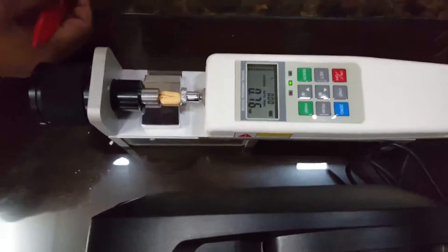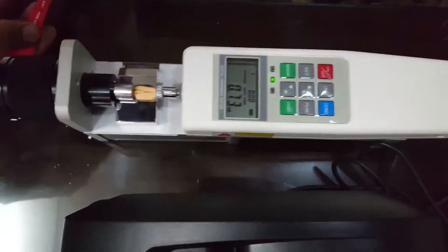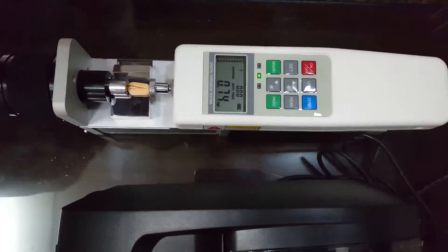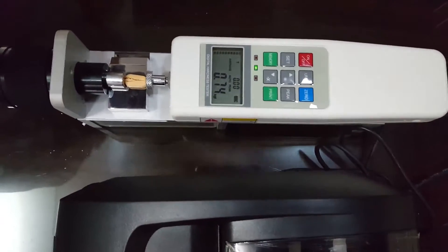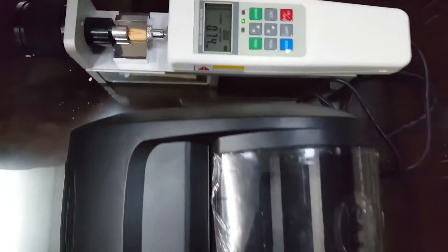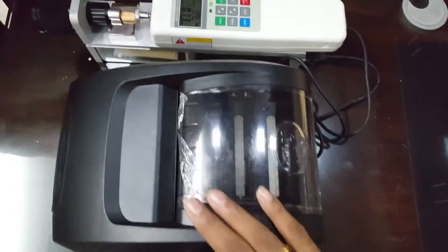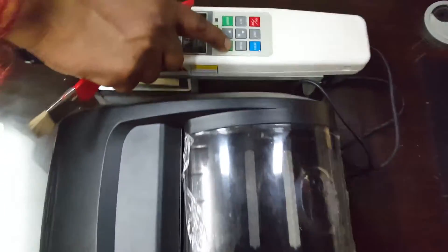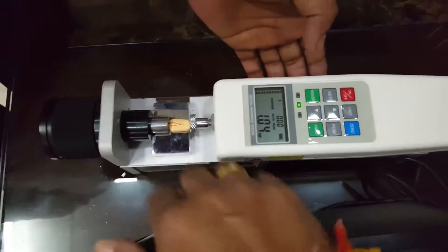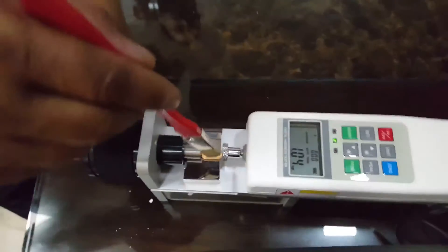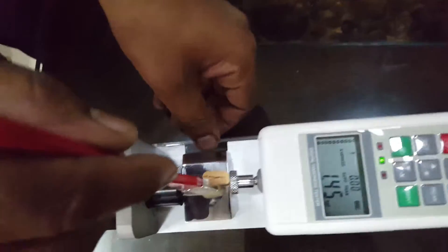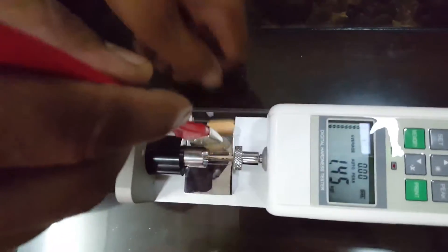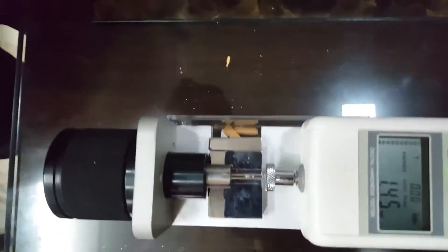We'll get the minimum, maximum, and average of all the tablets and we can take the printout on this printer. We have a disposable tray below the tablet so that we can throw the tablet in the bin.